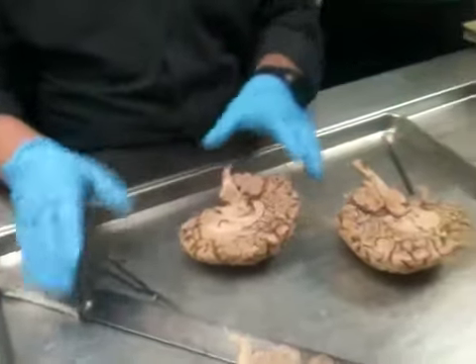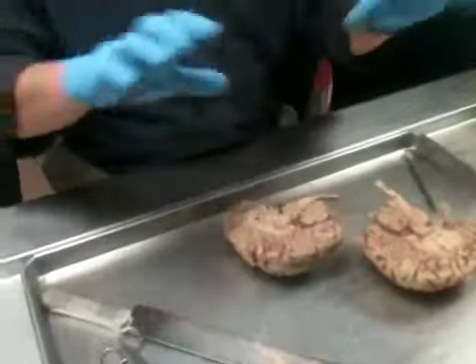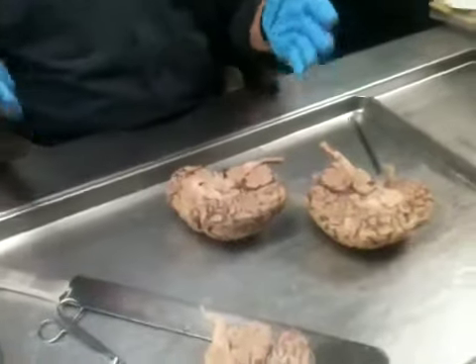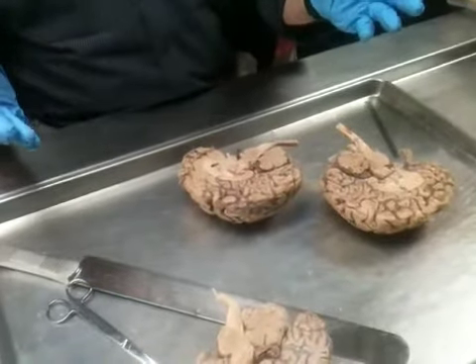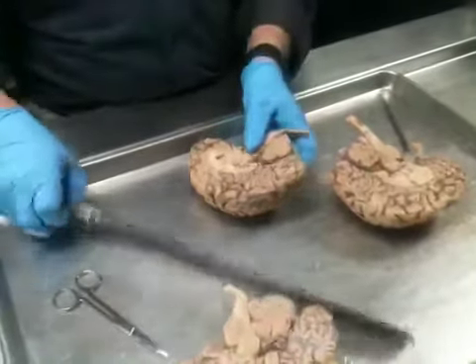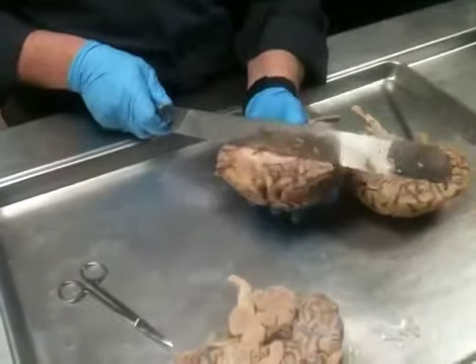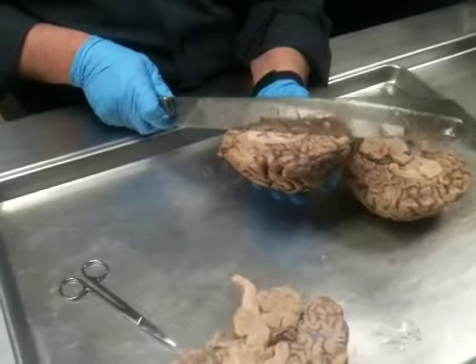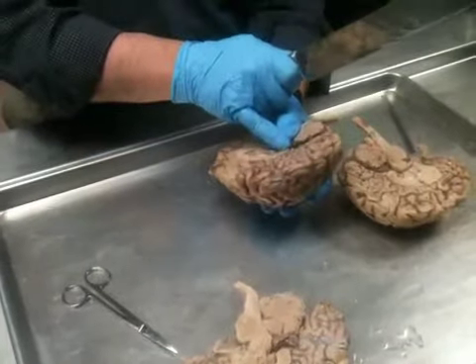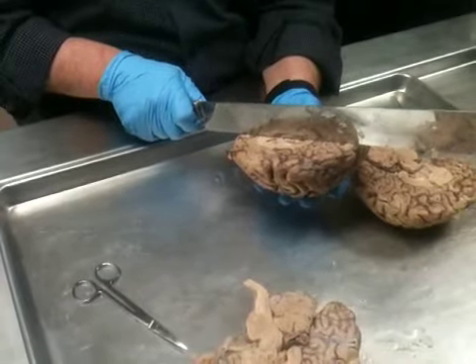So what we want to do now is look at this with respect to making the cut. The first one I want to cut is the horizontal, because that's the one we've used the template most of in class, which then defines basal ganglia, the different components of basal ganglia, and the internal capsule. So I'm going to make a cut right through the interventricular foramen. I'm going to angle it back here so I get just a little bit of the splenium of the corpus callosum, or the caudalmost part of the corpus callosum.